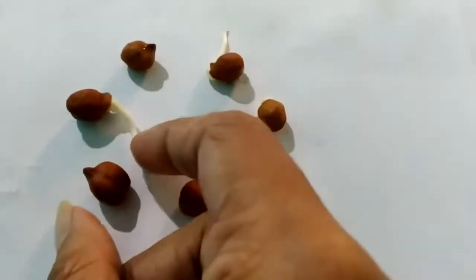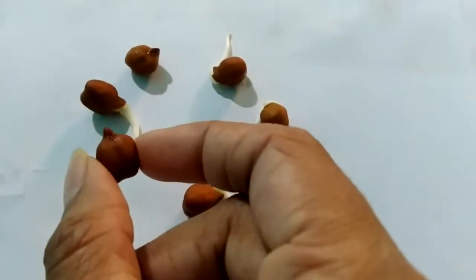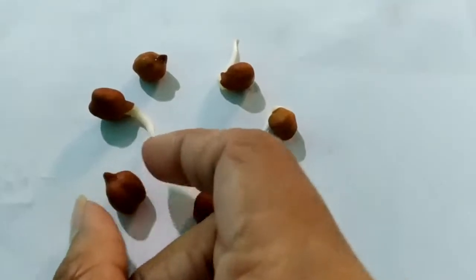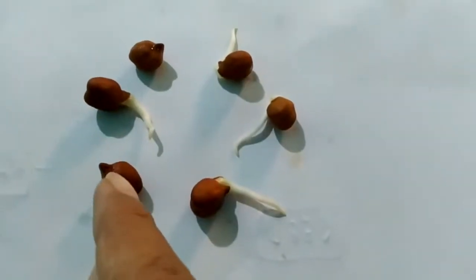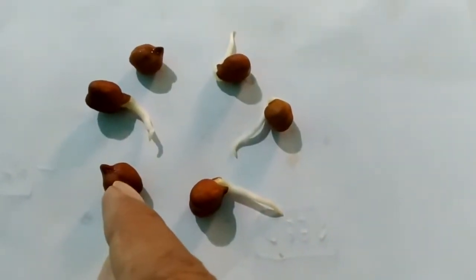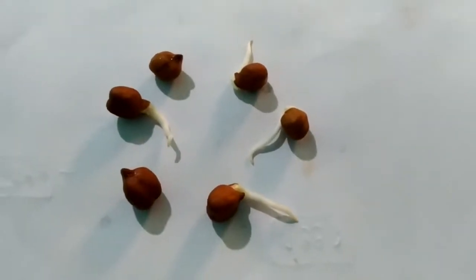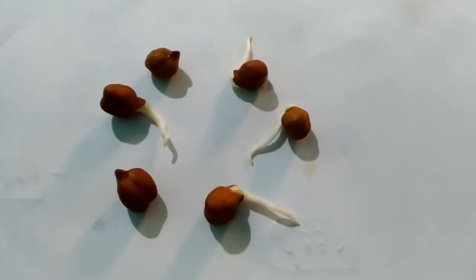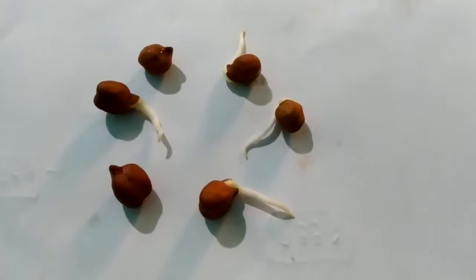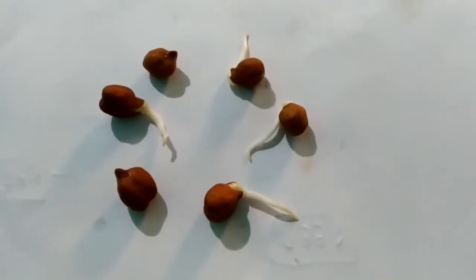Gram seed is a dicot seed. As you can see students, over here in the middle there is a portion. By dissecting this part, we will be getting two seed leaves. I will dissect it and show you that it has two seed leaves — that is why it's a dicot seed.